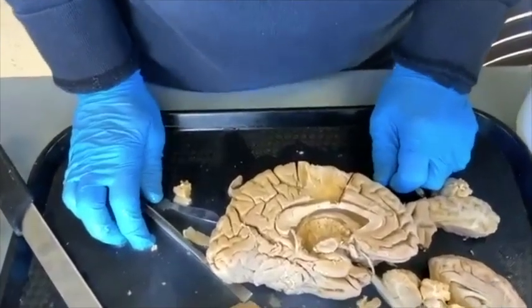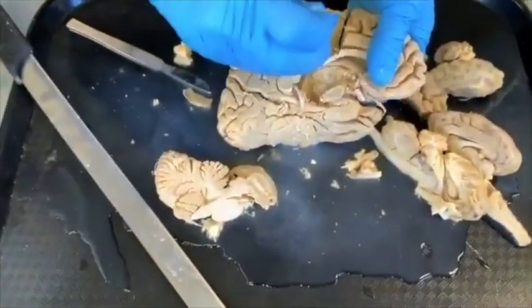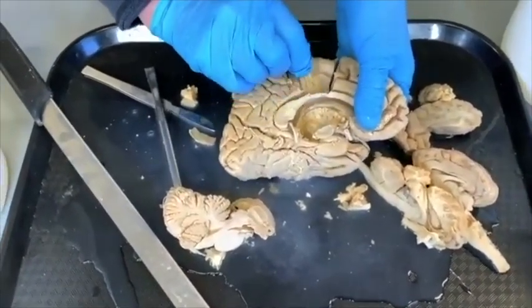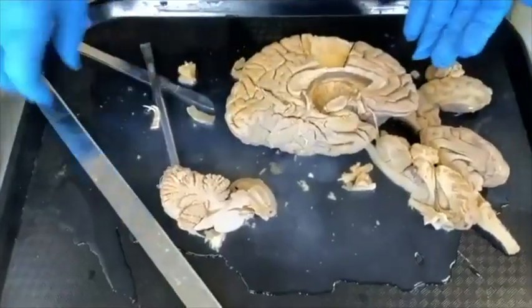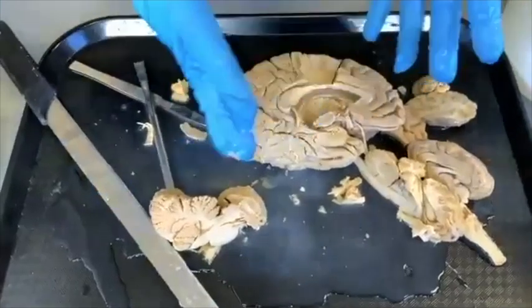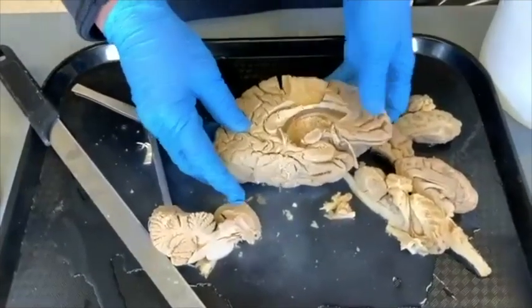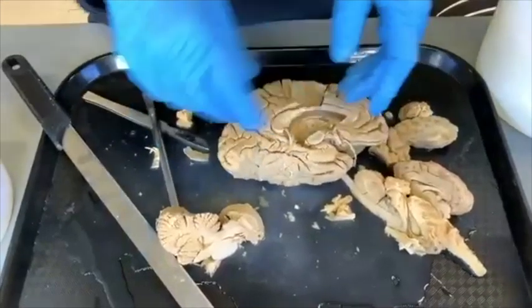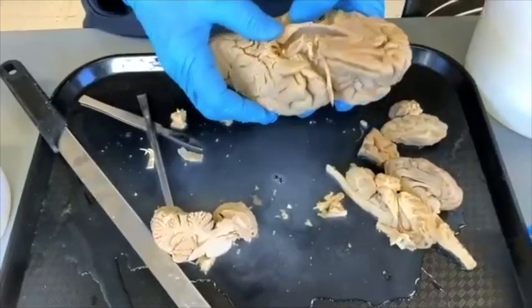Ramona wants to know why tearing is better than cutting. Think about these axons — the only way to go in the plane of the tissue is to tear. If I cut, I'll cut wherever I put my knife, but it won't follow the plane of the tissue. I got a head start on this because when I was a kid I used to do taxidermy. When you do taxidermy you really don't cut — you do what's called blunt dissection, following the plane of tissue.